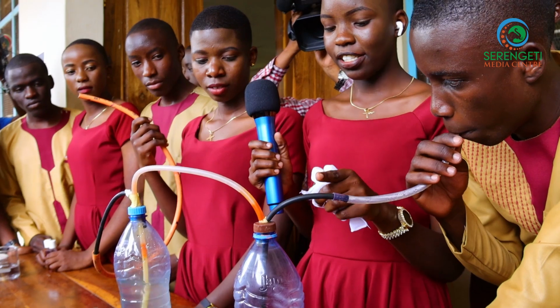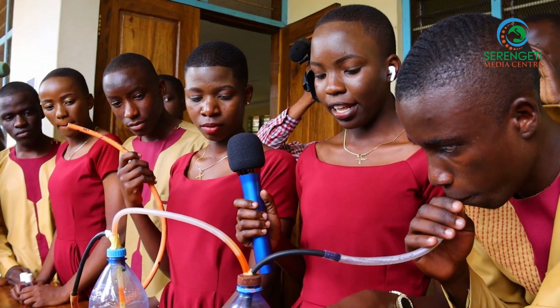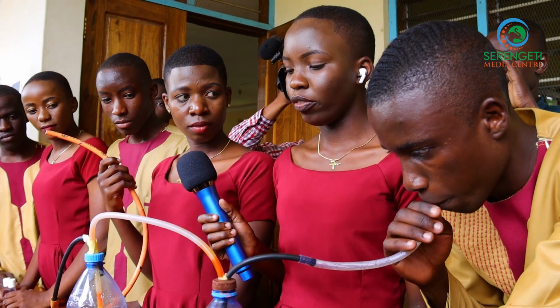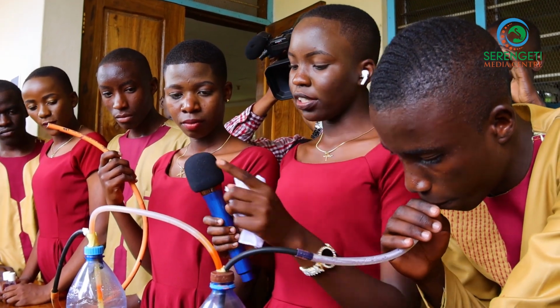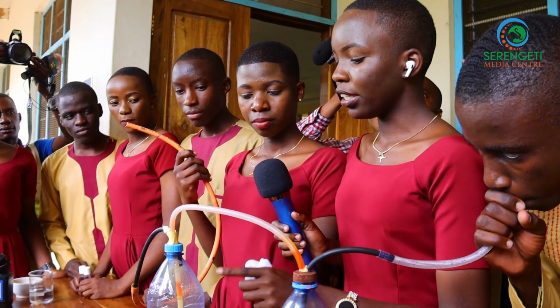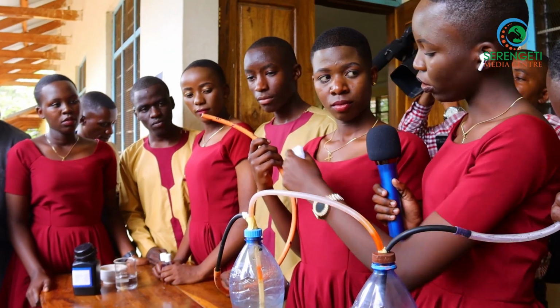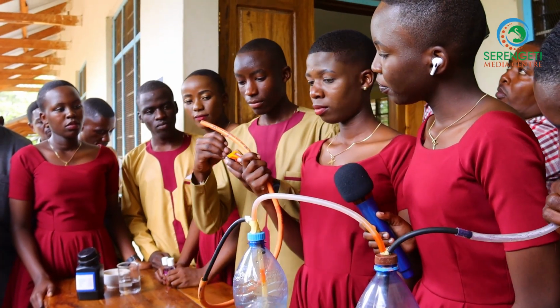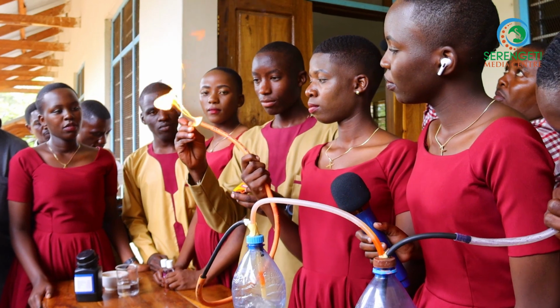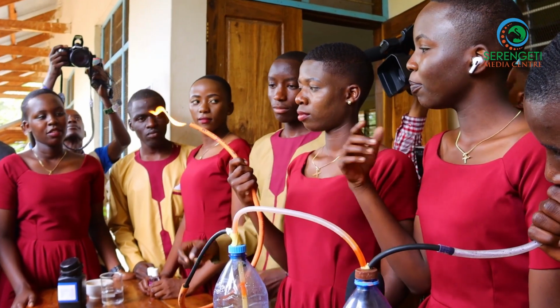Okay, here he is giving out air. That air is used to heat this fuel. As this fuel is heated, it comes here to the water. When it comes here to the water, it is being cooled by the water. Then it should light so it can produce a flame. As it's doing so, it's producing this flame.